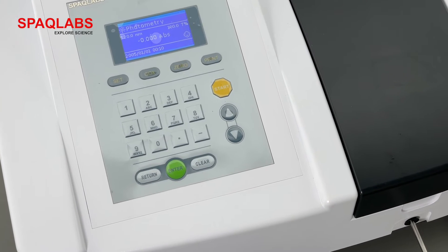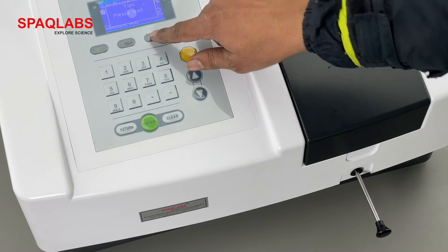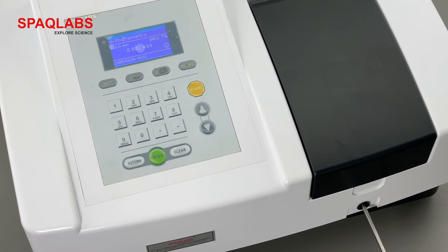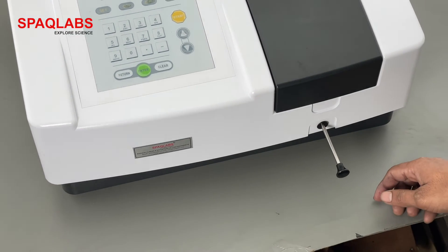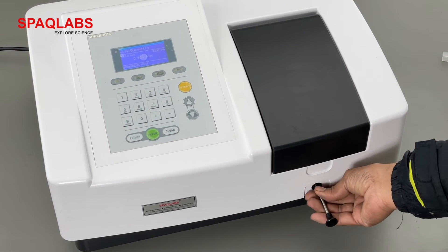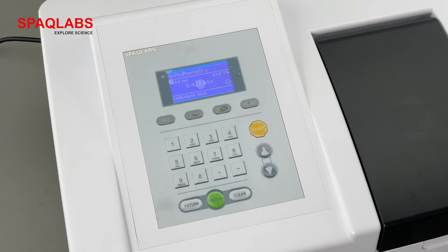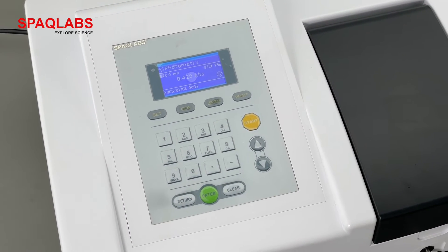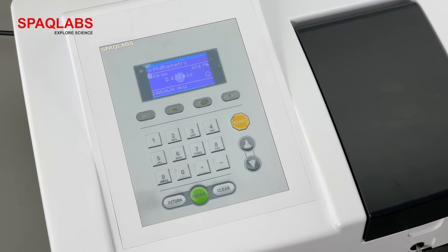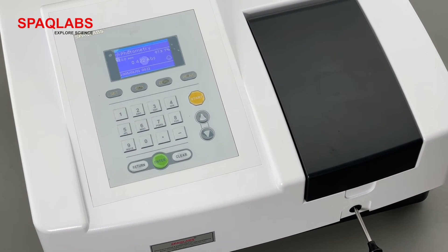The ABS value is showing 0.000. At this point, press 0 to zero the instrument since distilled water is inside. Now change the cuvette to the sample. This is the ABS value at 520 nanometers, which is 0.422 ABS.